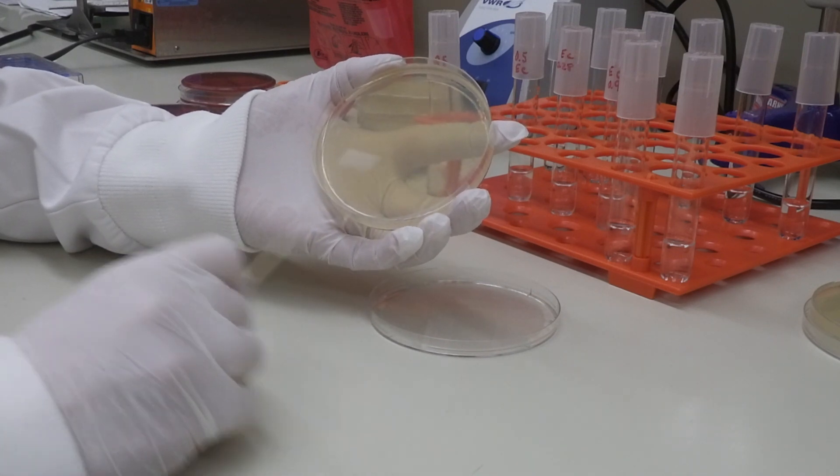As part of this video I've put together a concise visual guide for how to perform the disc diffusion test. You can download a PDF copy of this guide from the link in the video description below.